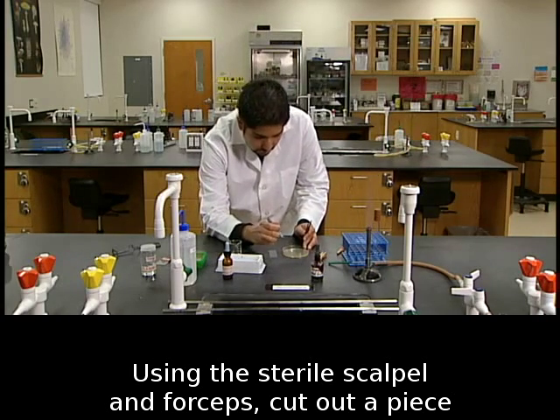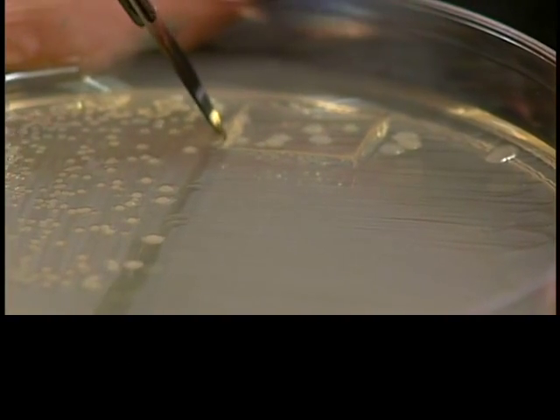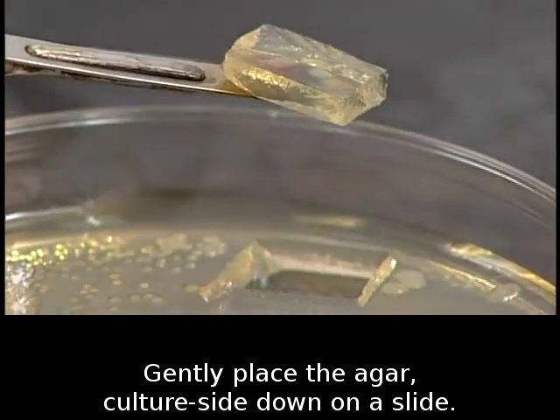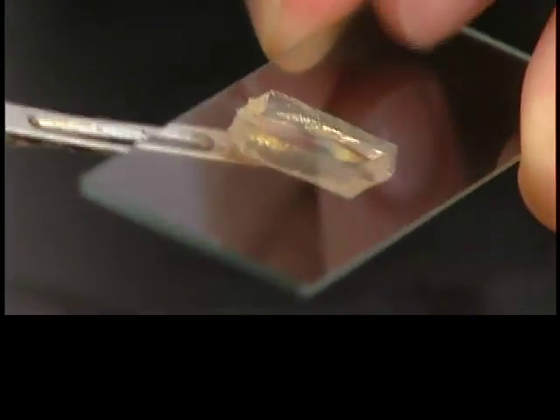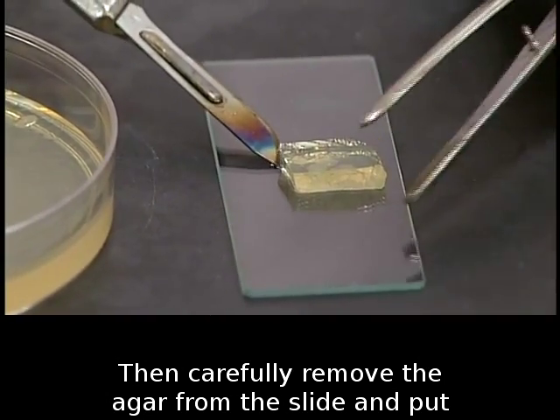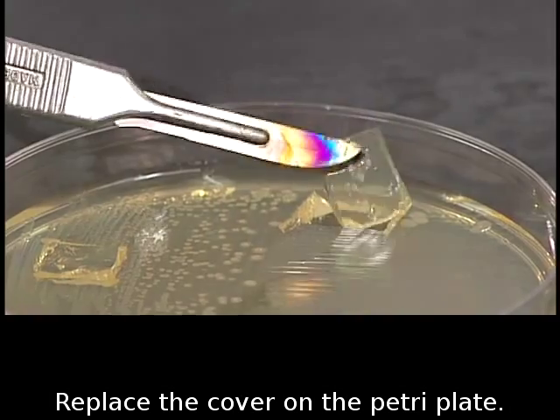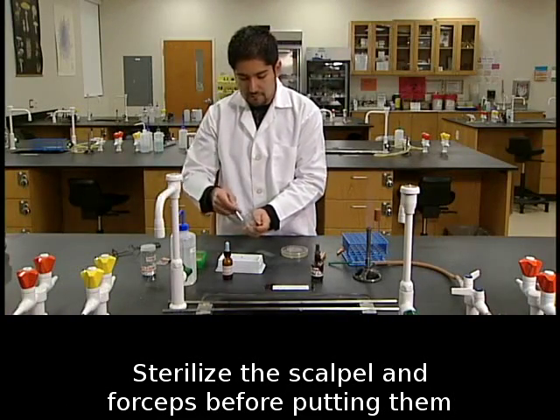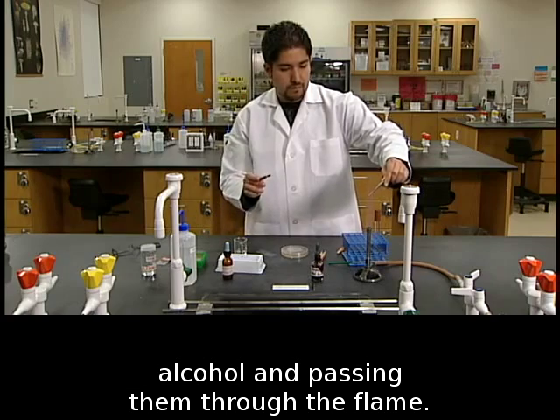Using the sterile scalpel and forceps, cut out a piece of agar on which your test bacterium is growing. Gently place the agar culture side down on a slide. Then carefully remove the agar from the slide and put the piece of agar back into the petri plate. Replace the cover on the petri plate. Sterilize the scalpel and forceps before putting them down by dipping them in alcohol and passing them through the flame.